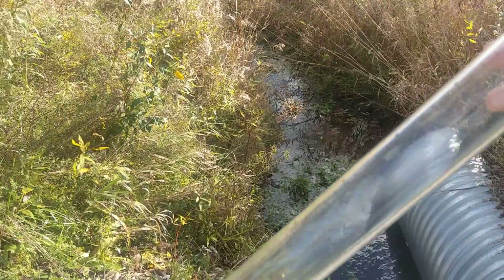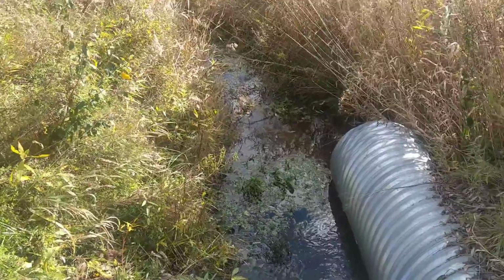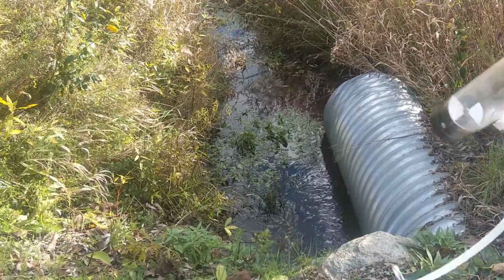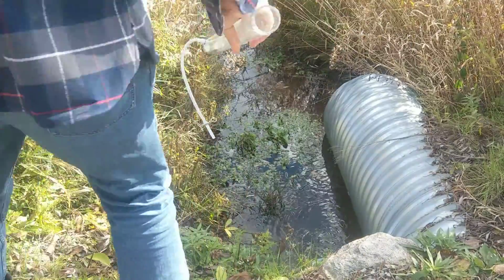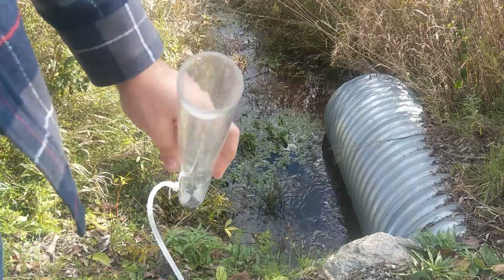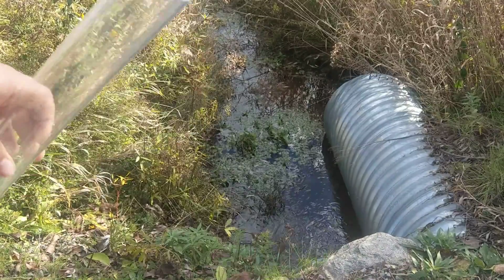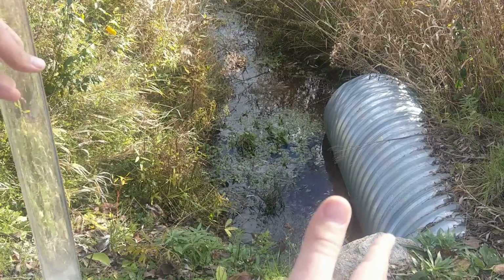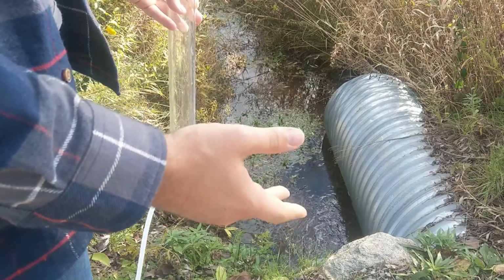We are going to fill this up with water, and this measures how much silt and turbidity there is in the water itself. So we are going to fill the tube up. Now you can do this one of two ways. You can fill it up directly, or my preferred method is to actually have a container and fill it up. I'll usually have benthic invertebrate tubs that we usually collect the benthic invertebrates in.